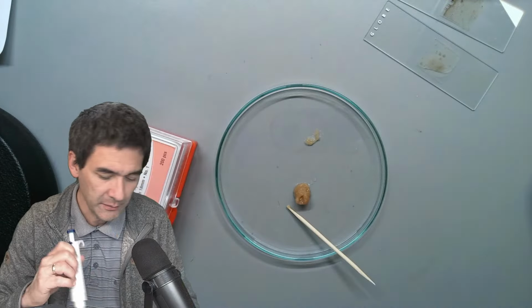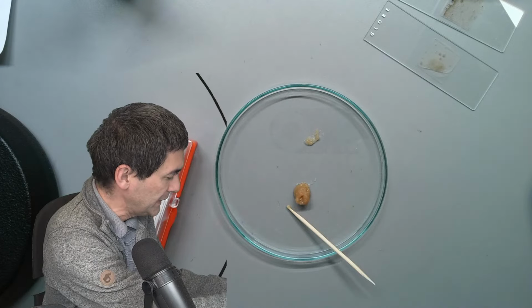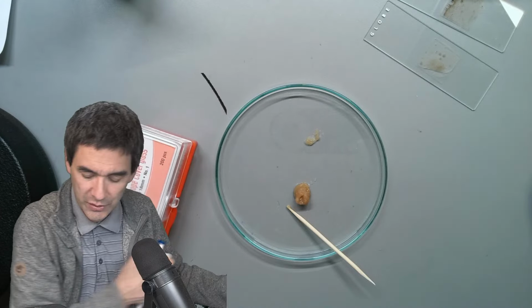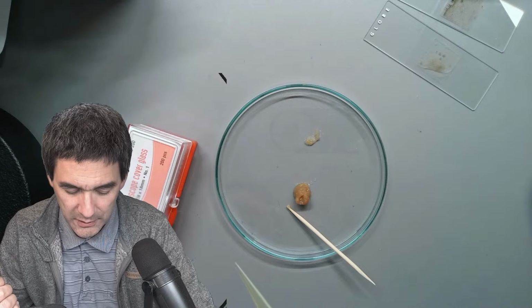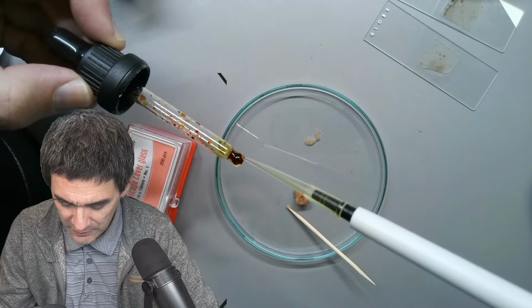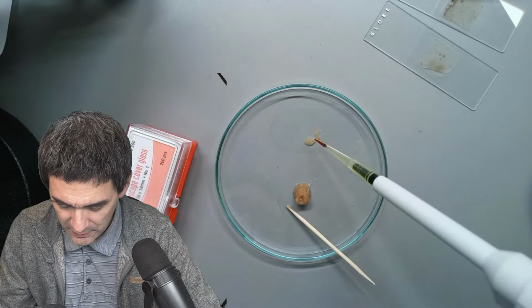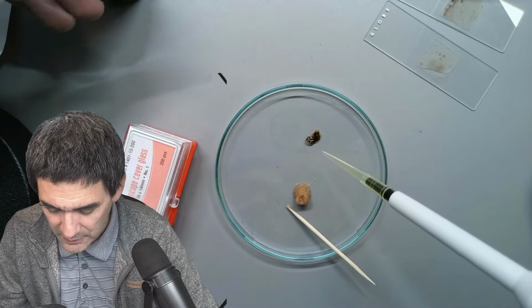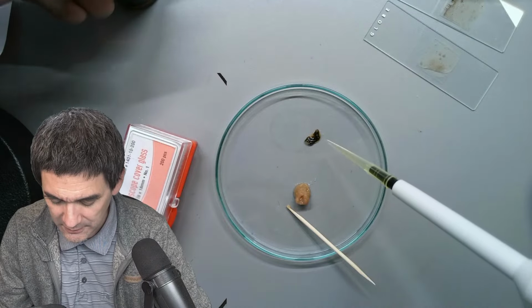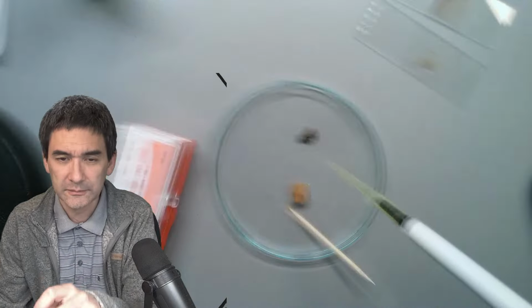And then we go again under the microscope, because the starch grains should then be visible very black, and this kind of shows, basically most like the banana starch. I always like to do it like this because otherwise there's simply too much. Yeah, it does turn pretty black.